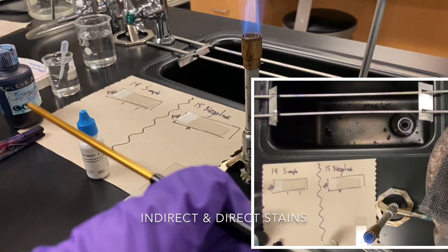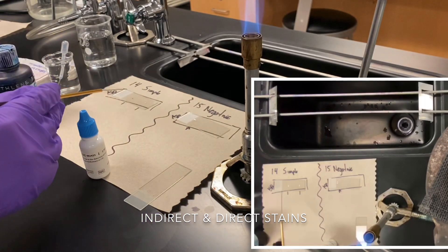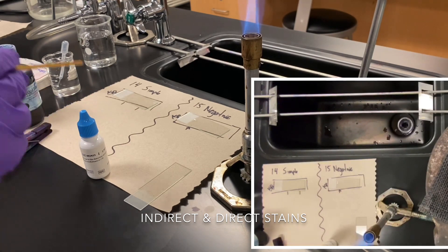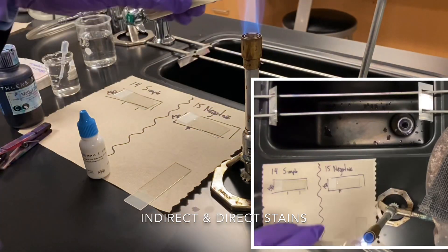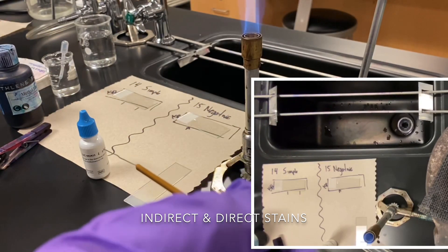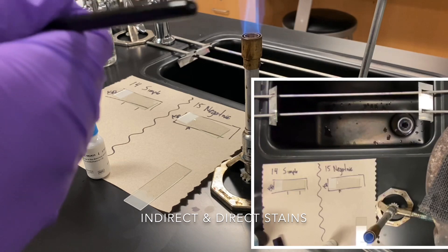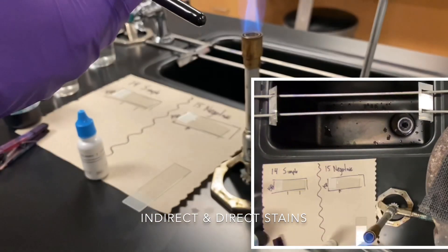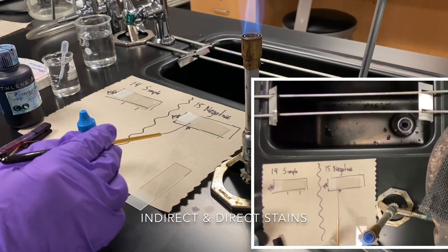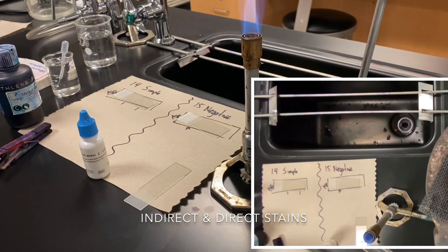After about 15 seconds have passed, we'll take our organism and smear it a couple of times — one smear to let it air dry, then immediately transfer to the other slide. Once the loop cools down, I'll add it to the negative stain slide. For that one, we're only going to go up and down with the loop to spread it as best we can, then sterilize the loop. And we're done with the samples.